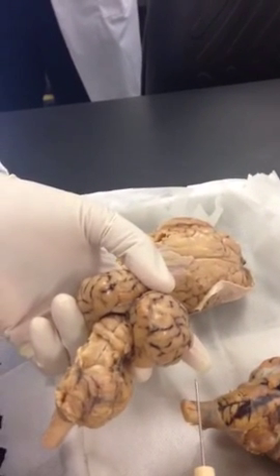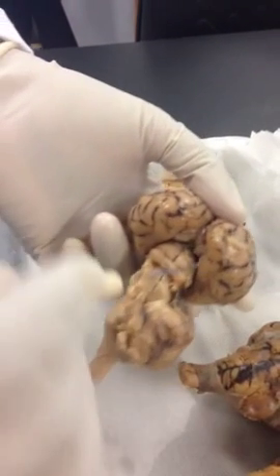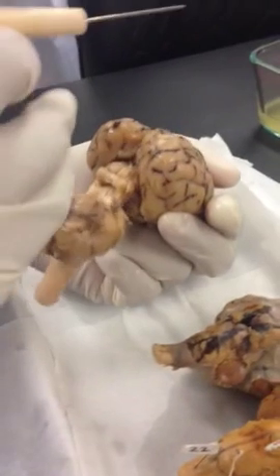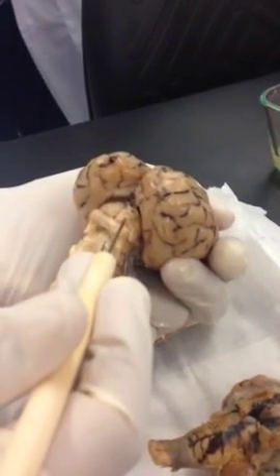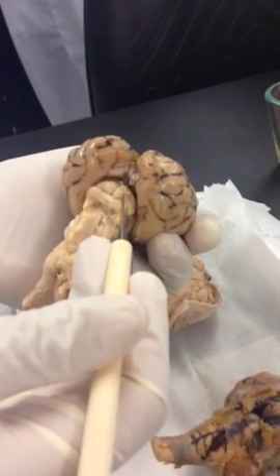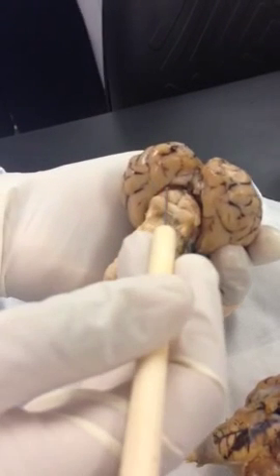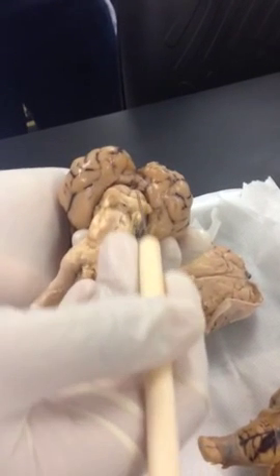The singular is colliculus, C-O-L-L-I-C-U-L-U-S. So depending on which one is being pinned, okay, can you guys see that, what I'm showing them? Okay, so depending on what is being pinned, if I am touching this, if you have to be specific, I'm touching the one here. So what would you call that? Right superior. Right superior colliculus. Correct. Left superior colliculus. Right inferior colliculus.